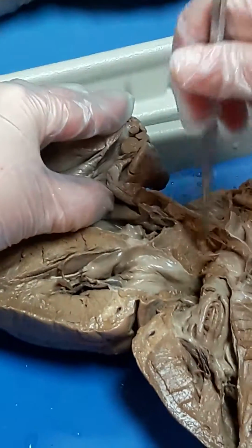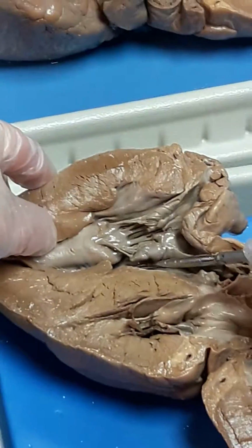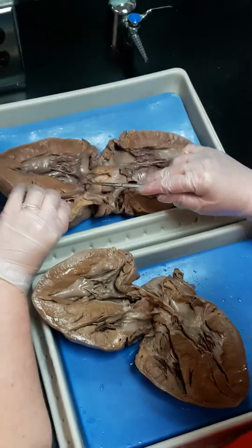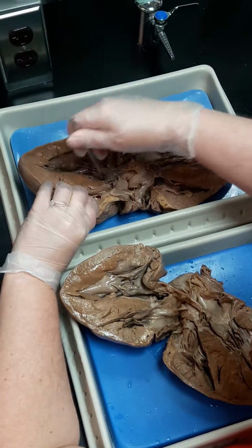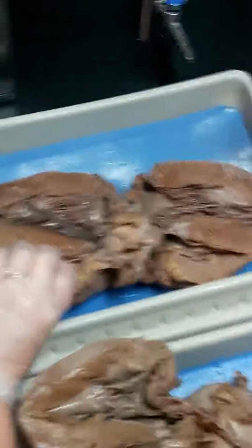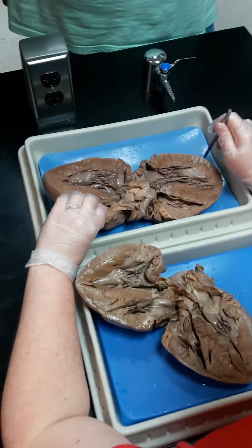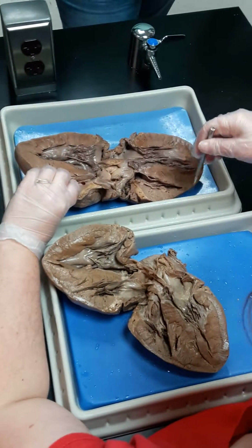All right, so this is the aorta. These are the aortic semilunar valves, and then this would be the left ventricle. But again, even for the aorta, let's see how this one's cut. These are all cut slightly differently. You can see the valve really well here, but the aorta itself is kind of horrible. So I'd have the probe in it and say, what vessel is this? Or what vessel is indicated by the probe, so that you can tell. I'm trying to think if there's anything. Oh, again, follow the blood flow, it helps you along.